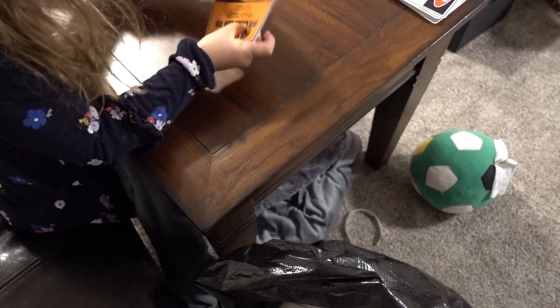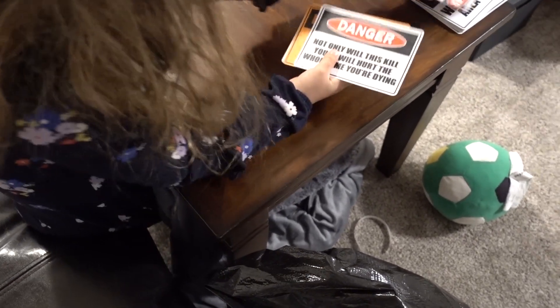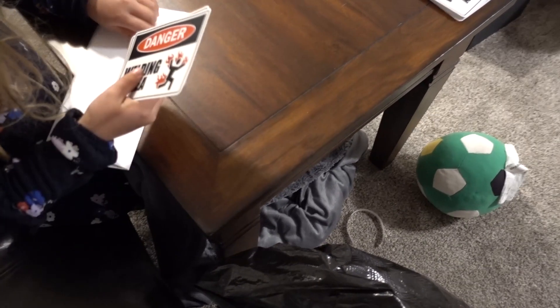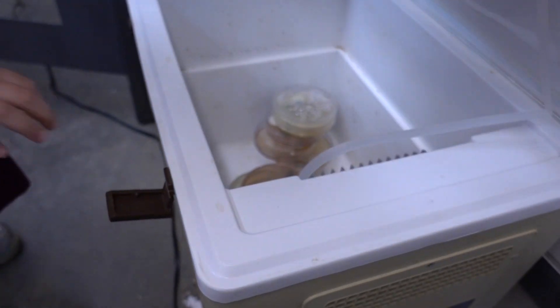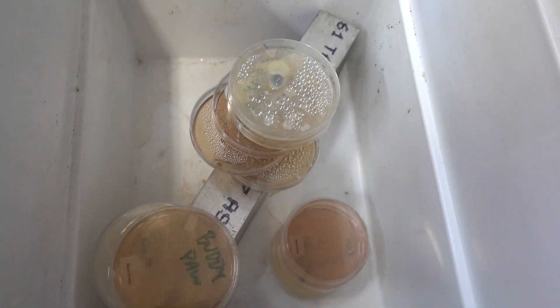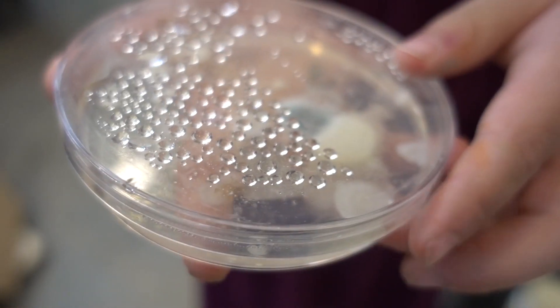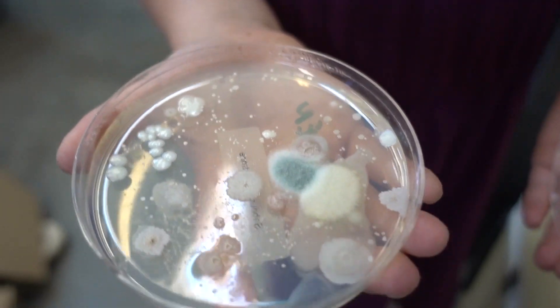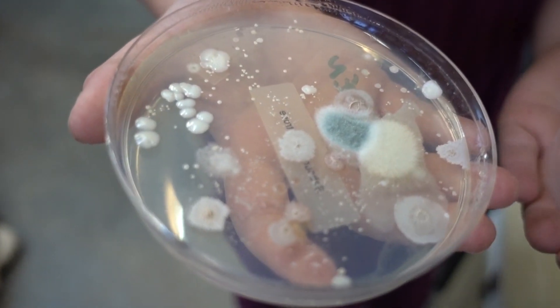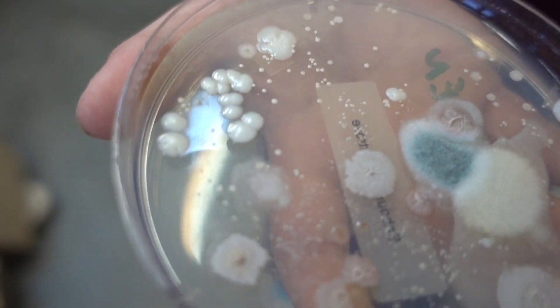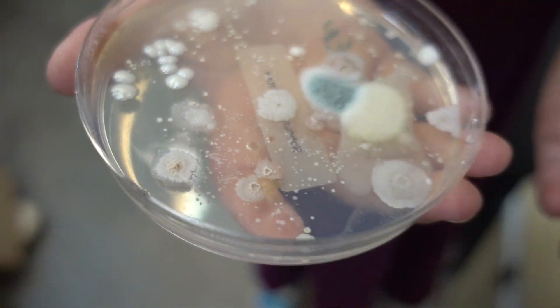Chickadee, what you doing? I'm packing envelopes for the boys and girls. Should we go check on our pets? The germs? Pee-yew, it stinks. It does stink. There's some bugs doing their work. Look at that. What do you think of that? Cool. Can I open it up? Whoa. What's it smell like, chickadee? Paint. Smells like paint. Those are some fungus. Fungus amungus? And some bacteria as well.